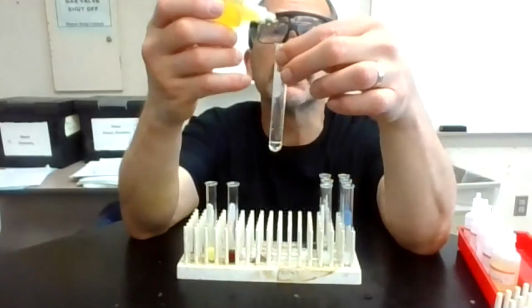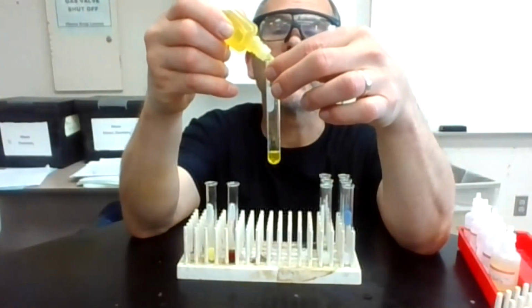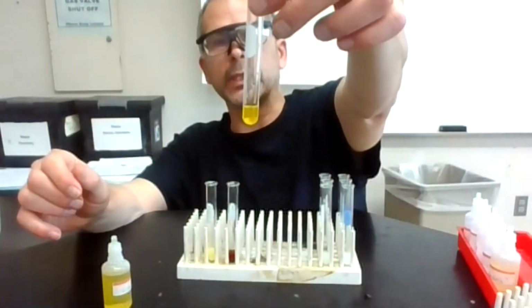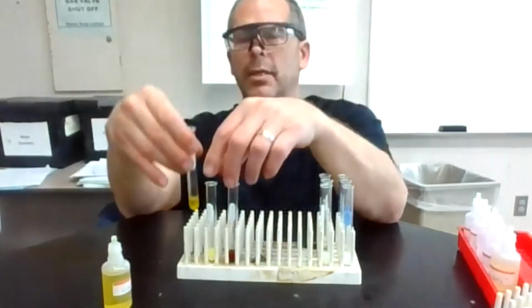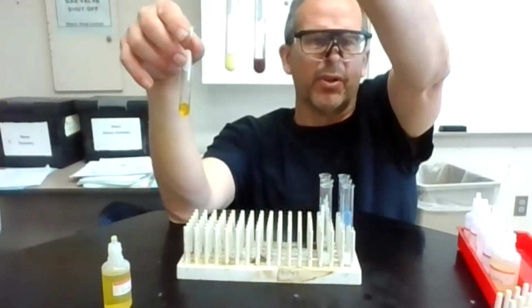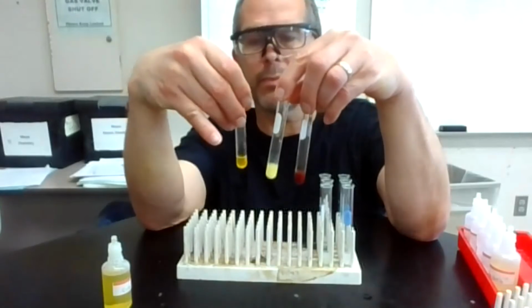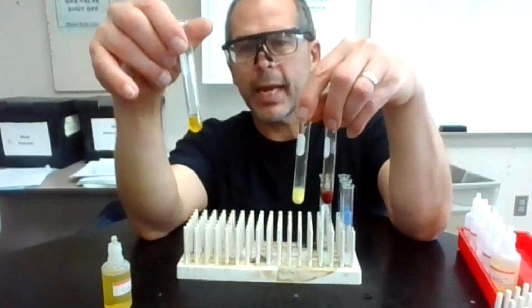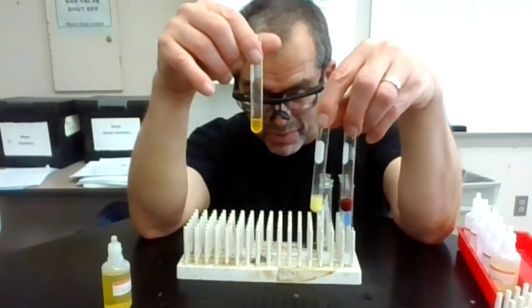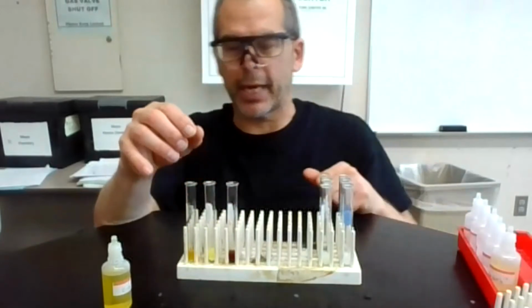And then the last one is the zinc. 1, 2, 3, 4, 5, 6, 7, 8, 9, 10. Okay, so that one looks clear, although it's yellow. Maybe a slight haze that I'm getting with that. Okay, so here we go. If we look, there is the silver, the red one, and then the other one, get that on a black backdrop, that is the barium, and it's starting to sink to the bottom. And then there's a slight haze. It's just the yellow color of the solution, maybe a slight haze with the zinc, but I'd say no precipitate. But I might just say it's slightly hazy.